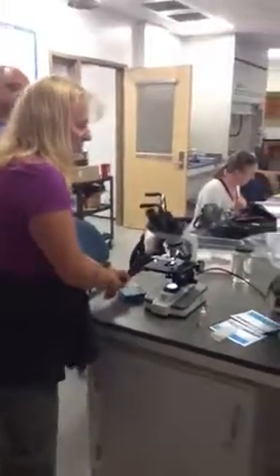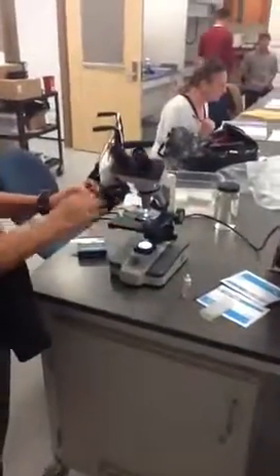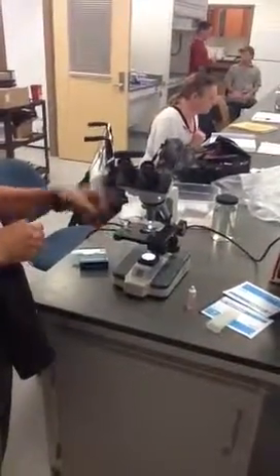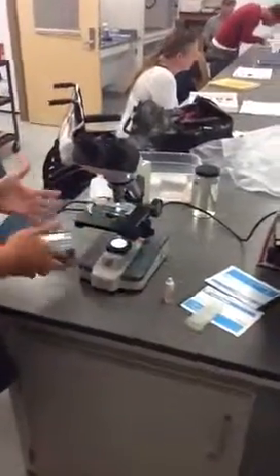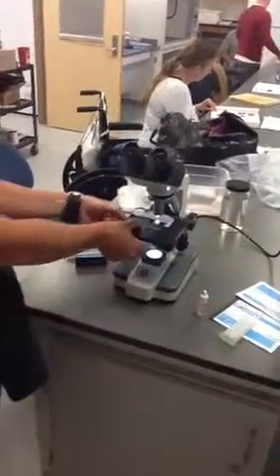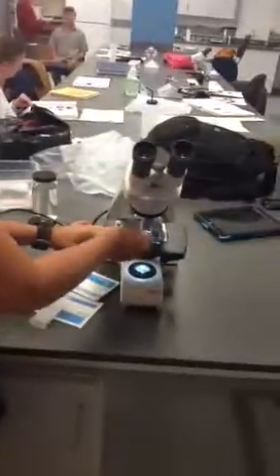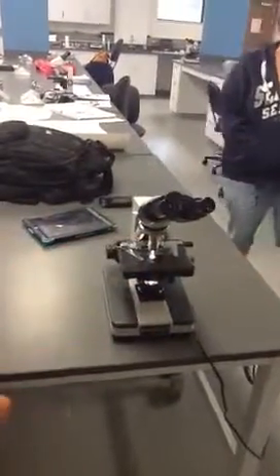They all have a stage and stage clips to hold the slides. The slide goes in here — you don't want to lift this up, it's just meant to gently hold it in place. If you find something on a slide and want to come back to it, you can use these little lines on the sides of the stage to note where you found something. This arm goes here; this one doesn't move that much and has a smaller arm, while this one has an arm that goes down.